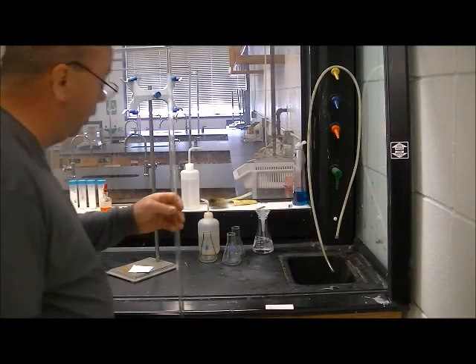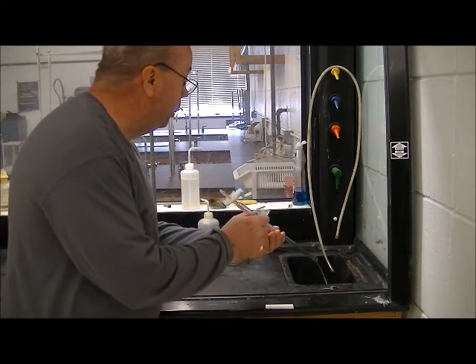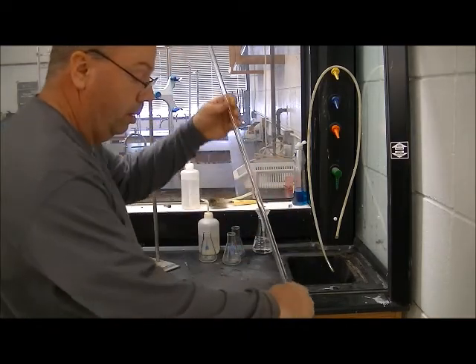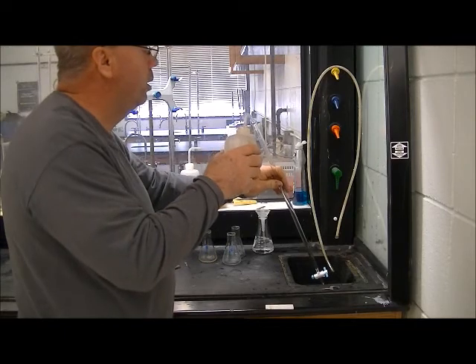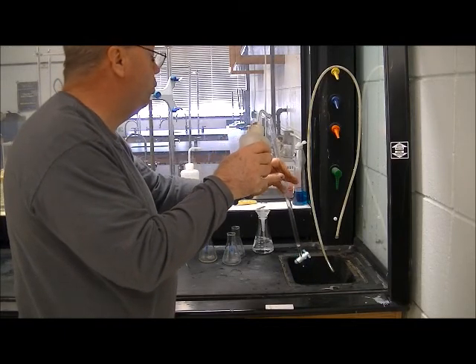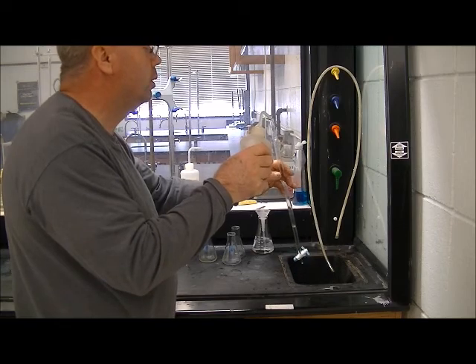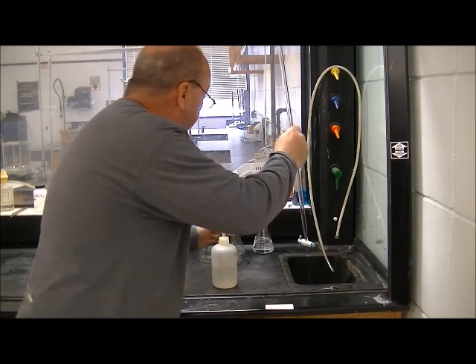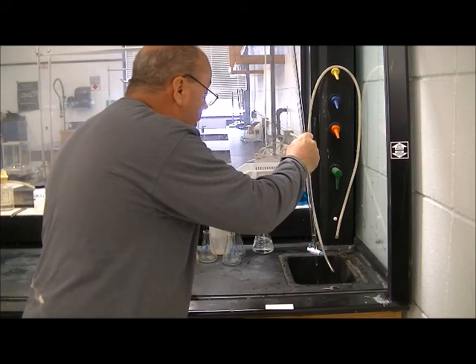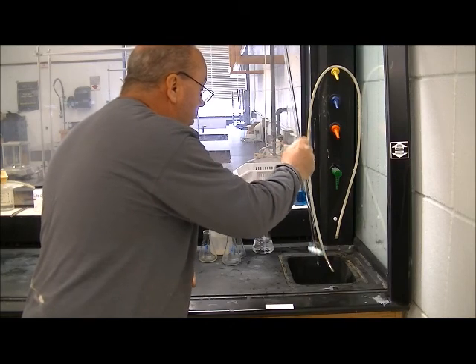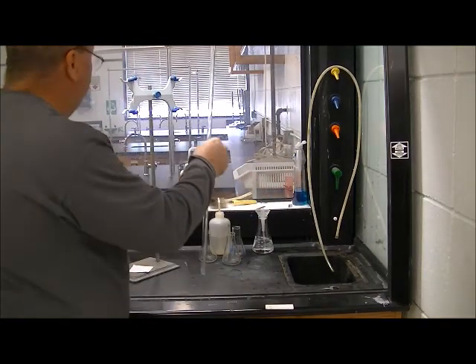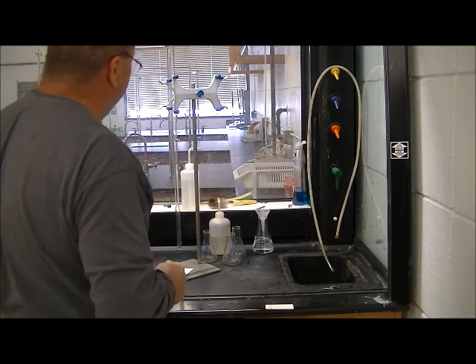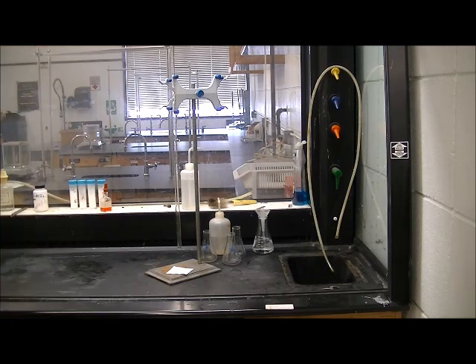At the conclusion of your lab, any remaining titrant in your burette is disposed of in the sink. The burette is rinsed with distilled water. Leave the stopcock open and put your burette back in the clamp upside down like that so it can drain. And it's clearly indicated that that's been cleaned and prepared for the next person to use.